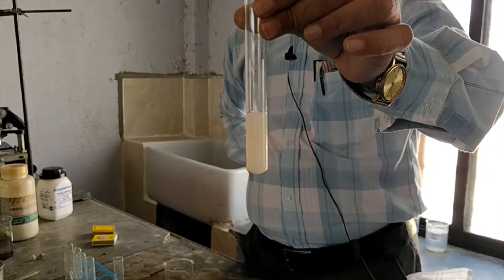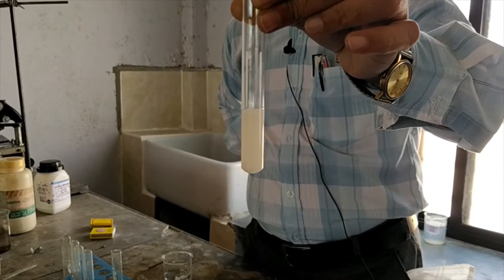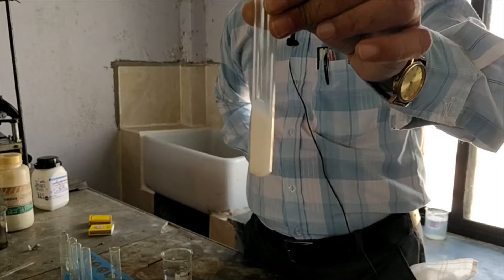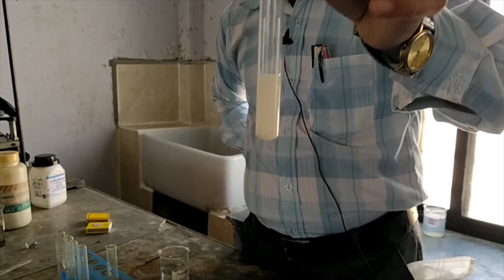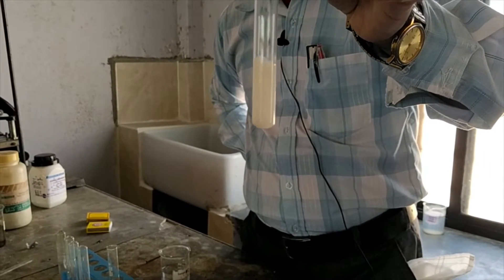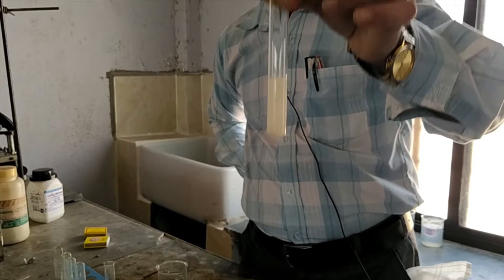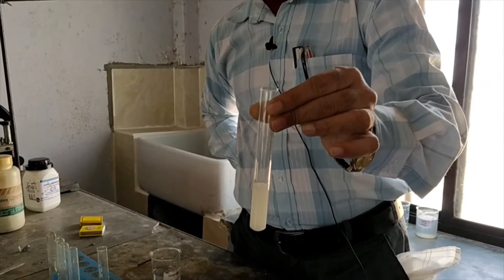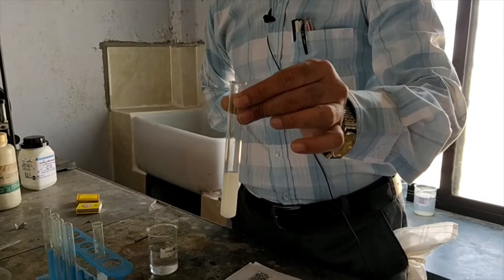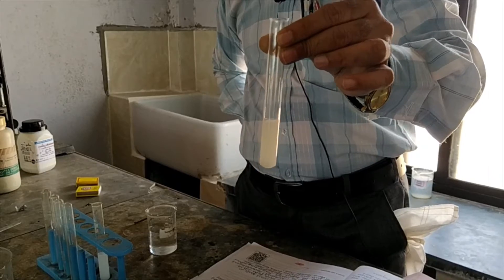Can you see? Here you will see the colour change — it is pale yellow. It might not be seen clearly in the test tube right away, but after some time you will notice the colour.